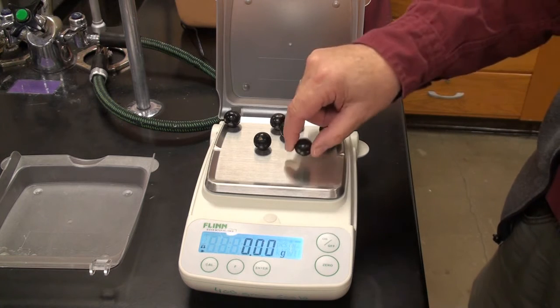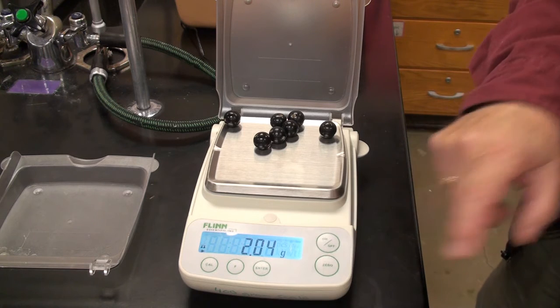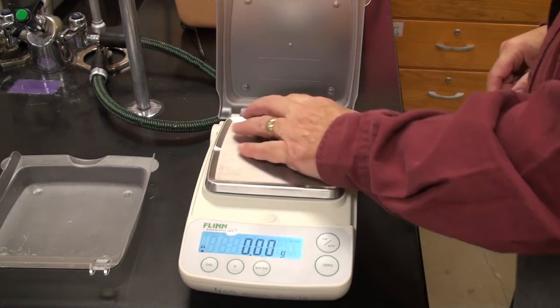Zero it. Seventh one. Zero it. Eighth one. All right, that looks consistent.